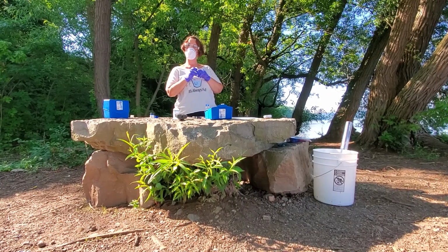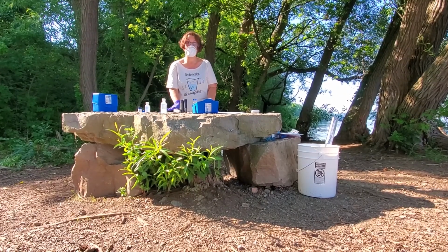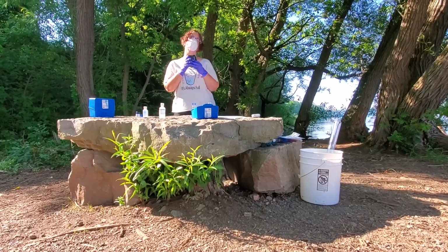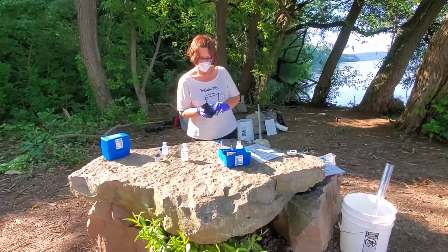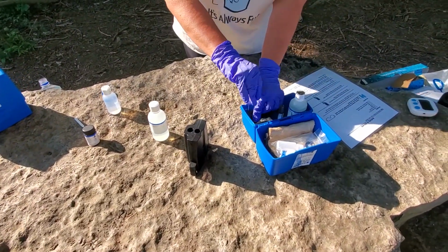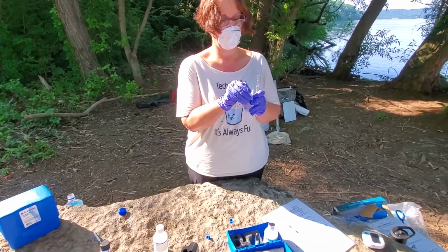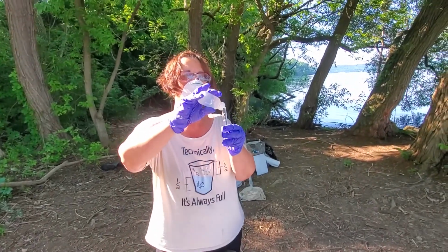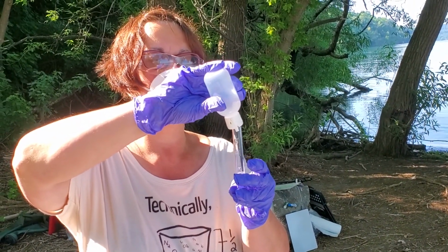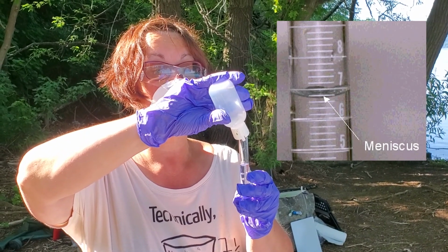I am now going to get some sample water from our site. And this is how we go ahead and test for nitrate concentration. We use this nifty little thing called a nitrate comparator. In order to use it, we have to prepare the water in certain ways. I'm going to take the first of the test tubes, take the sample water, and fill it up to the 10 ml line. Of course, as we know from science class, we measure from the bottom of the meniscus.